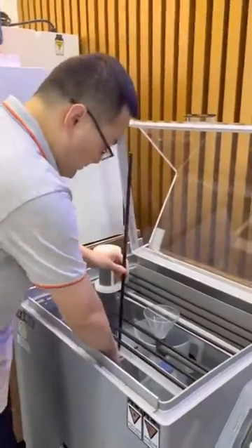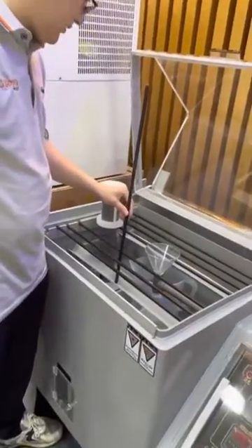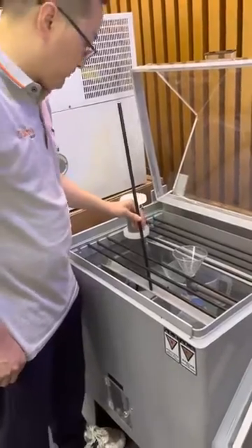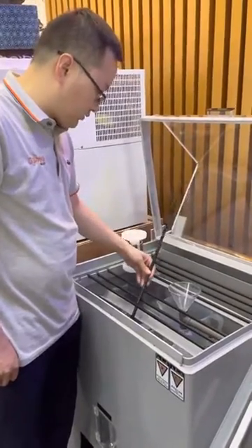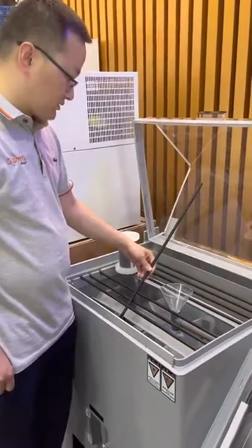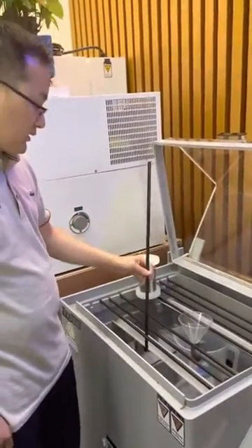When it's 90 degrees, the current amount is very high. When you control the angle to 45 degrees, this current amount is half of 90 degrees.